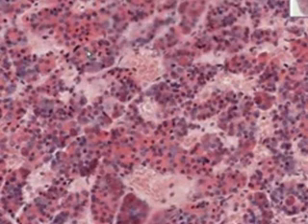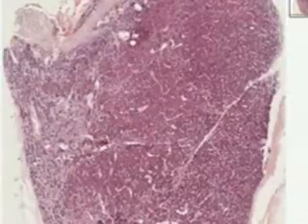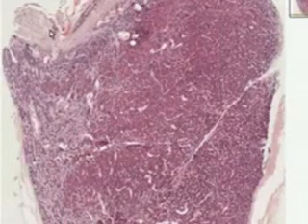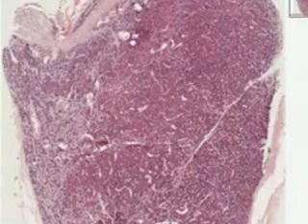And do we really want to say anything else about the pituitary? I don't think so. I think we pretty much covered everything. So that will be it for the master endocrine gland of the entire body, the pituitary. Posterior lobe, intermediate lobe, anterior lobe, stalk, and that's it in a nutshell. And therefore, I thank you very much.